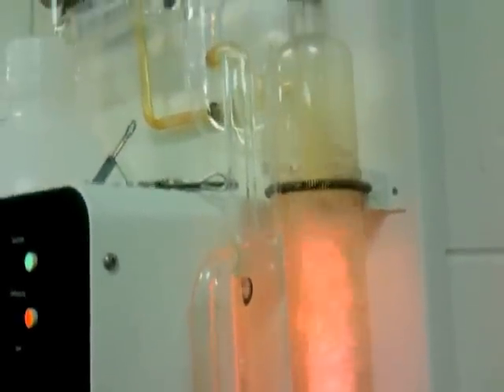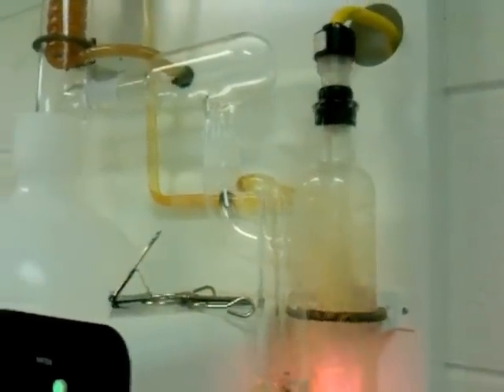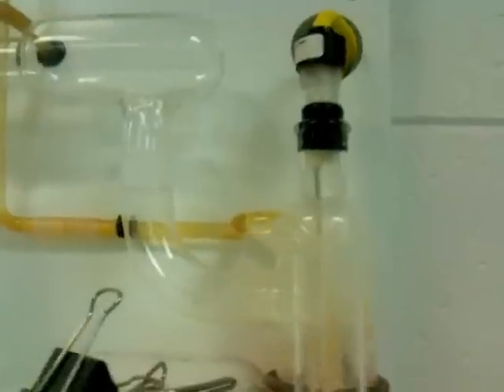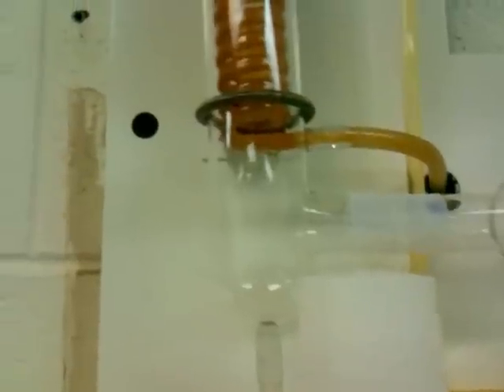We've got boiling water, and that's just tap water. We've got water vapor — the steam — that's coming up. That steam comes over and up into there. You can't really see it, but it's in there — water vapor — and then it goes up into here.